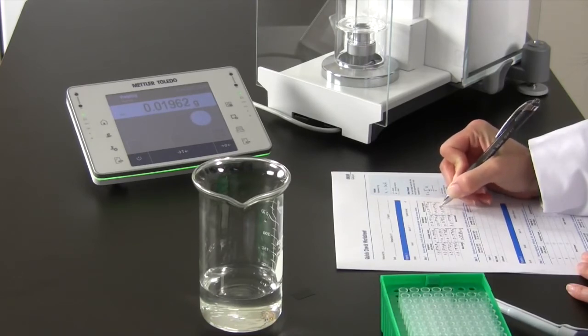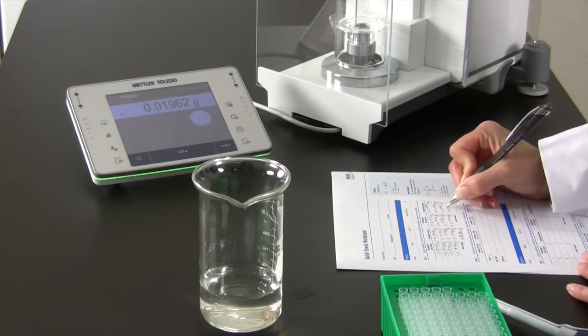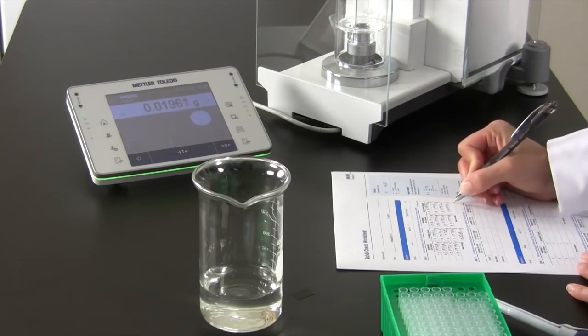Finally, compare your results to the manufacturer's specifications. If your results don't match, you'll need to send your pipette in for service or calibration.